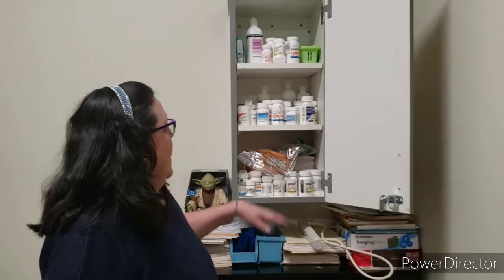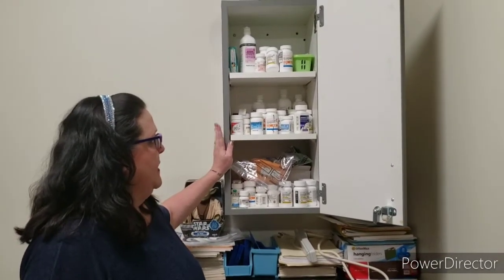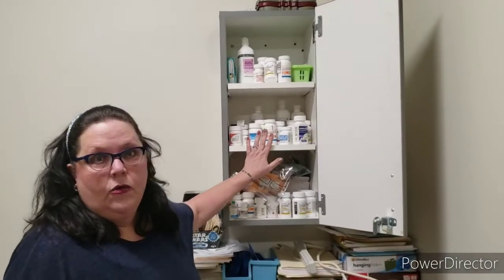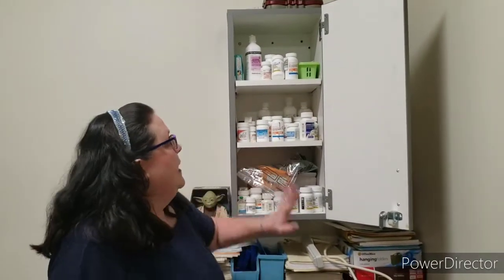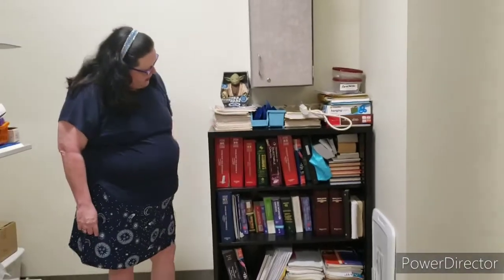Controlled drugs, control 2 drugs, and you'll learn what those are, are put in a safe and kept locked up. These are medications like morphine, codeine, Dilaudid. And again, this is all placebo. We don't have the real drugs here in the lab. Here we have our references, so if you really want to look up a particular medication and find more about it, all that's right here.